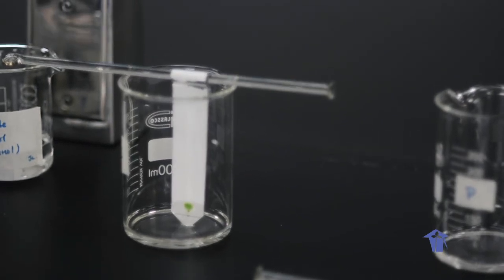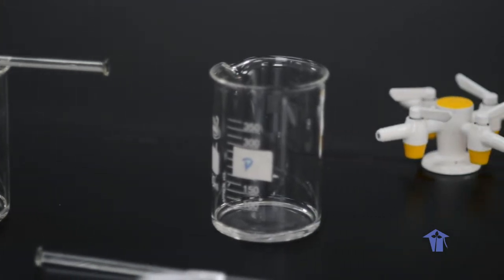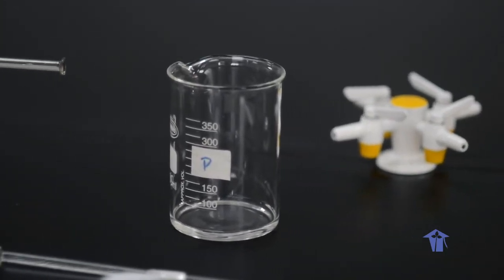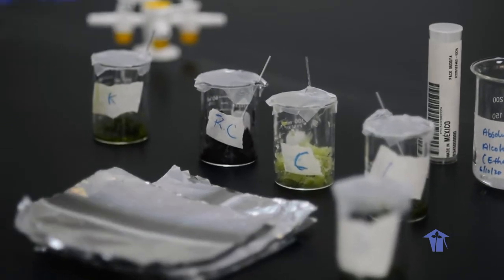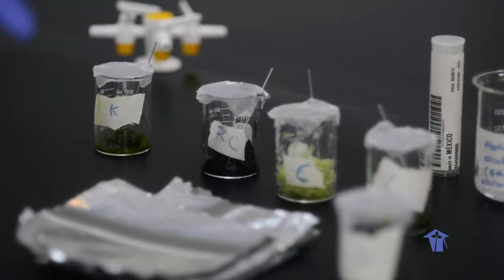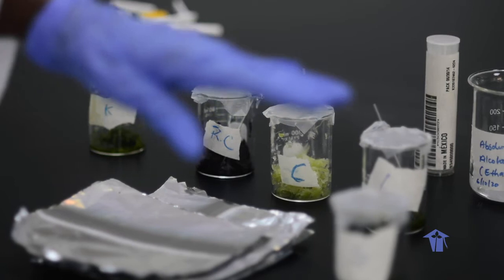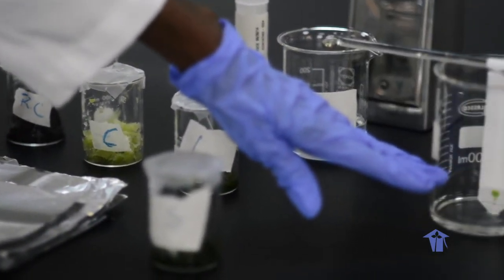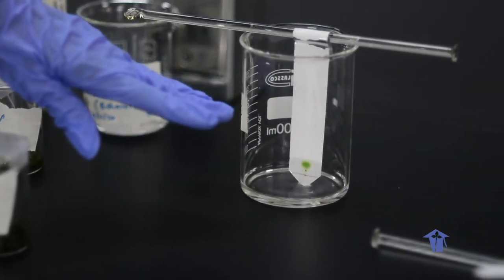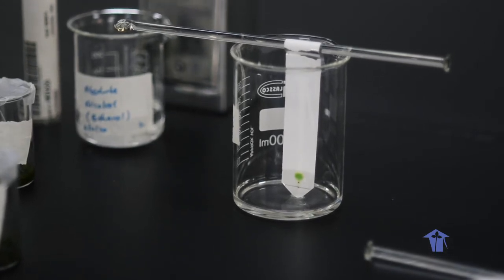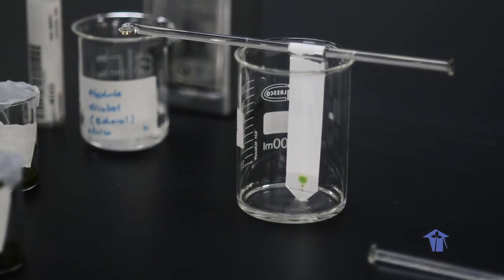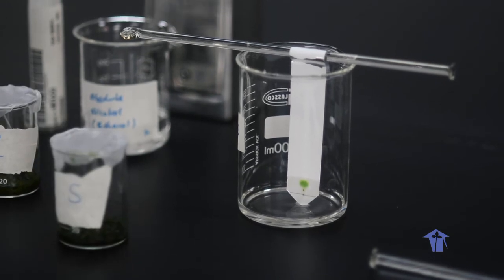The other five sources of pigment are going to be set up next, and at the end of a certain period of time, we are going to come back and take a look to see what our results look like, because our aim is to compare the various types of pigments that are found in these six different leafy vegetables.